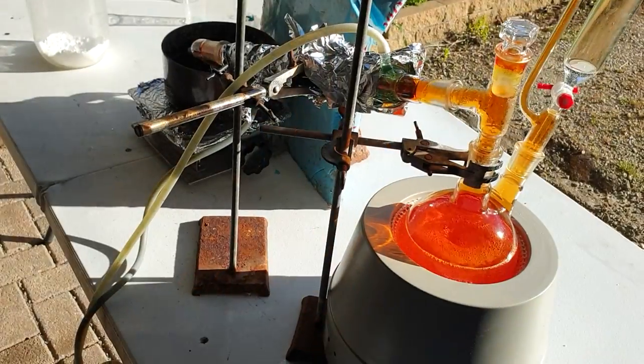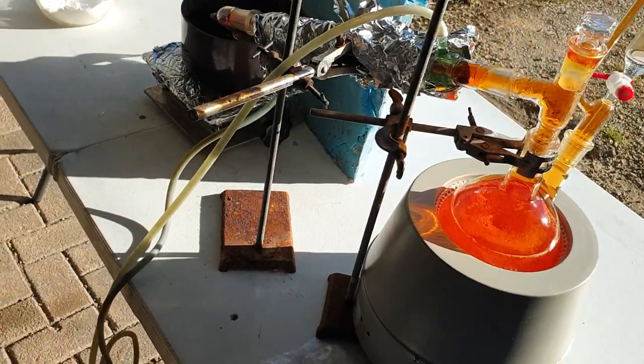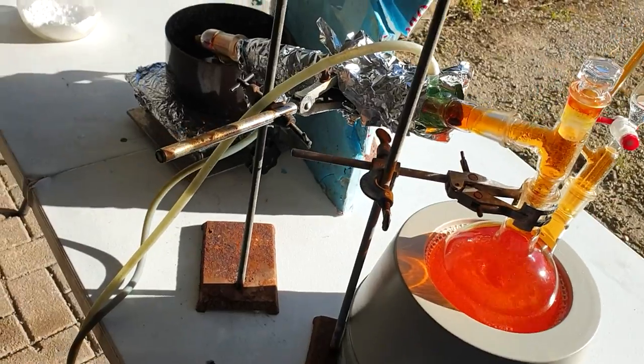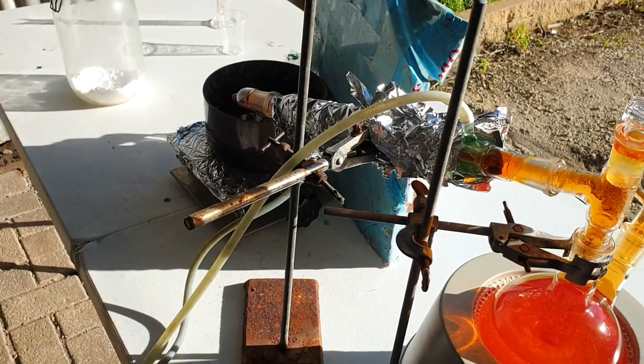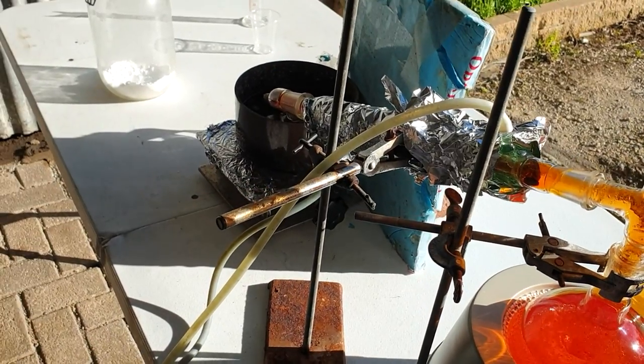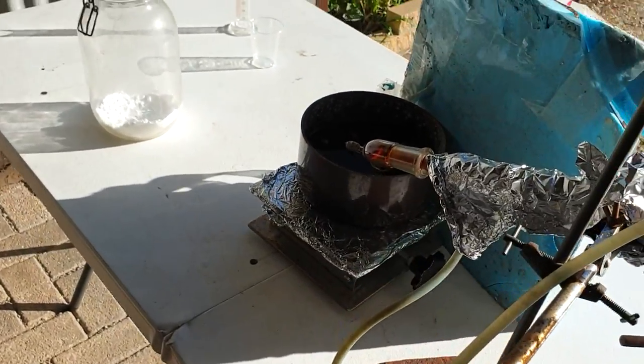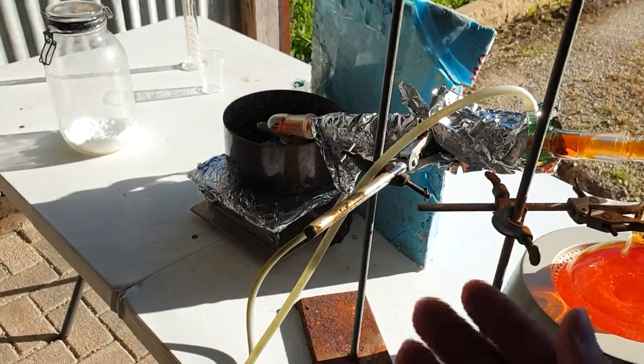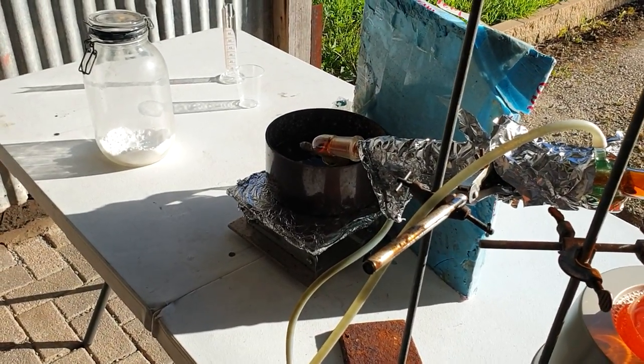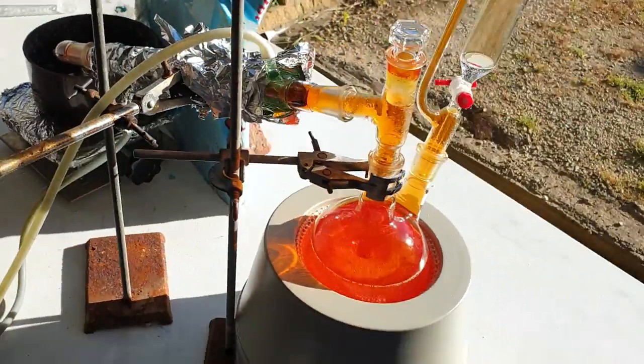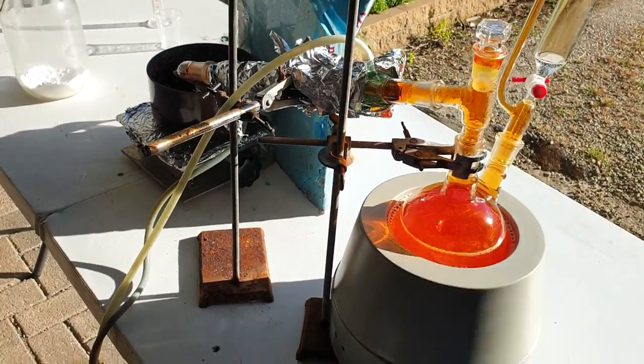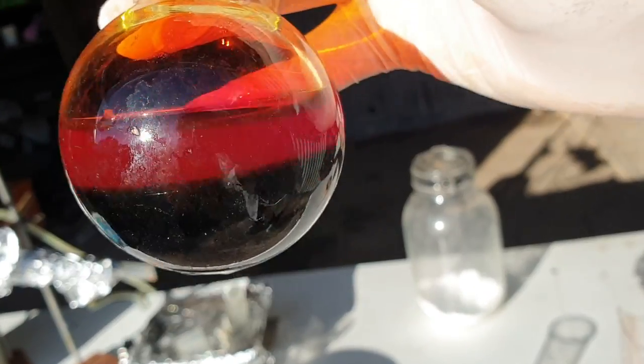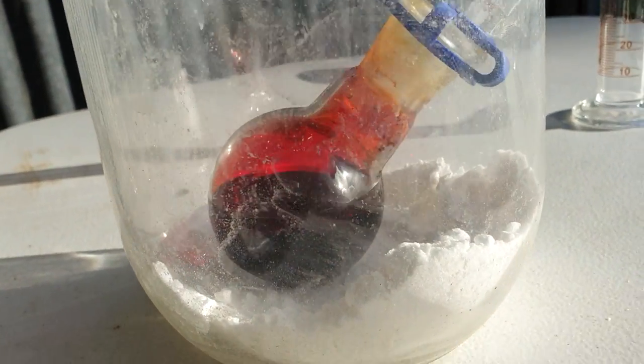All right, I think we're pretty much done here. What I'm going to do, because I'm really out of time for today, is just get this bromine—I think we've got quite a bit of it. Sorry, it's getting protected from the light by that thing. As soon as I set this up, the bloody sun came in and started heating everything up and bloody vapors were going everywhere. Doing my best to block out the sunlight. The bromine, I'm just going to add some cold sulfuric acid to it, leave it in that flask. I'm just going to put it in this jar as well with some bicarb at the bottom to neutralize any fumes. Hopefully the layer of sulfuric acid at the top sort of stops the fuming a little. Ideally I'd be able to put it in a freezer, but I don't have a lab freezer. I'm not about to put bromine in the normal food freezer—that's not very nice of the freezer or the foods. Hell yeah, safe and secure, well at least I hope so. It's got a little layer of sulfuric acid there.